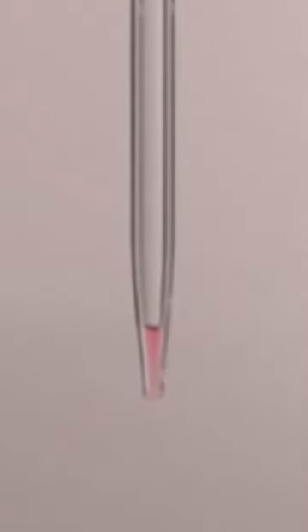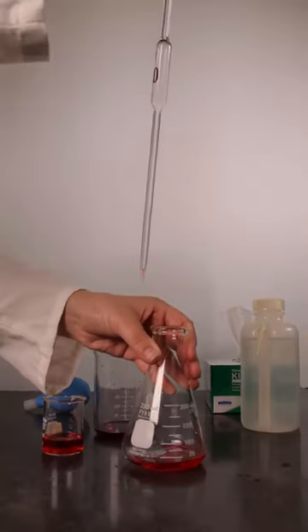Note that some solution will remain in the pipette tip. This amount should not be forced out with the pipette bulb as the pipette is calibrated for this amount of solution to stay in the pipette.